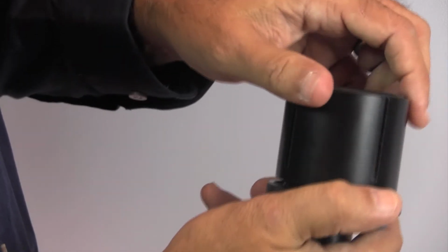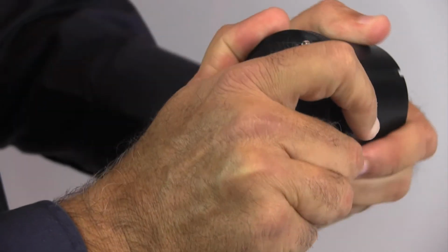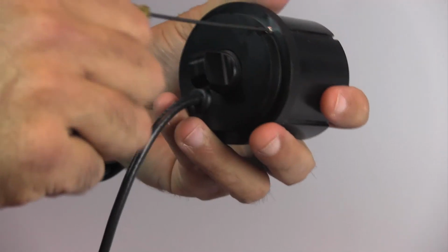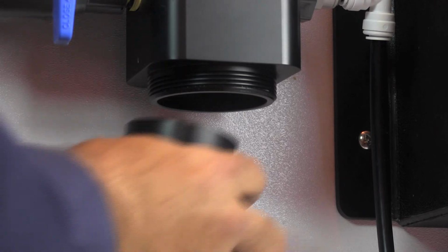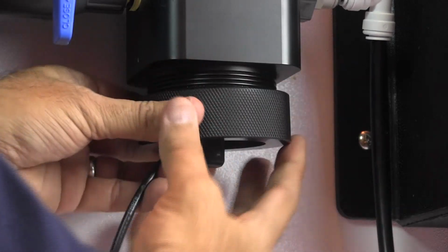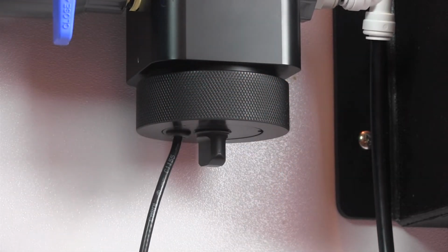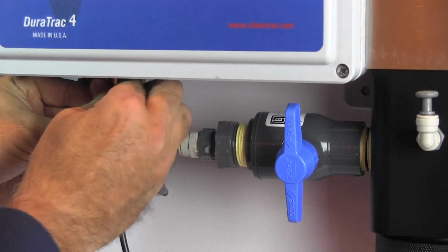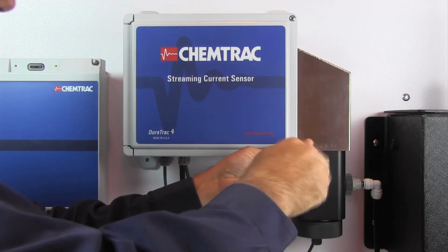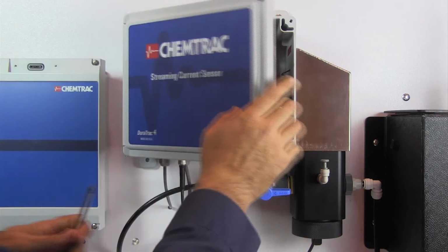Put the sensor housing back on and hand tighten as much as possible. Tighten the set screw. Insert the probe cartridge back into the DT4 block and hand tighten the probe retainer nut to secure it in place. Connect the probe cable and re-establish the sample flow. Repower the unit and the sensor will be back online.